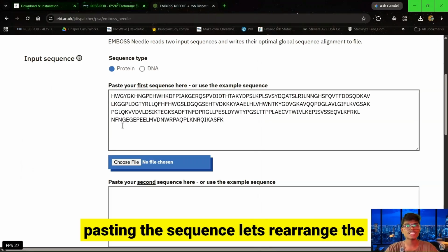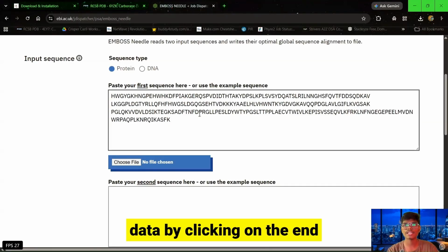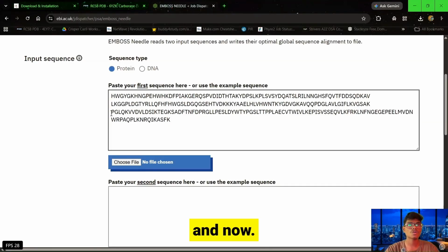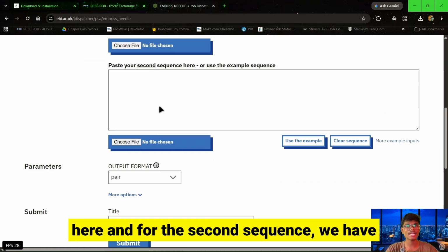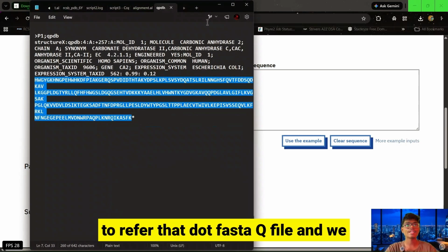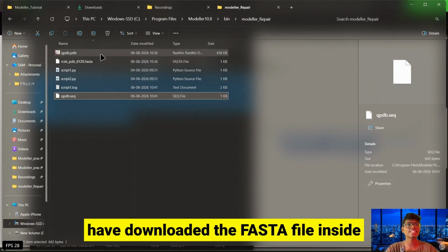And after pasting the sequence, let's rearrange the data by clicking on the end. Okay, the first sequence has been registered here, and for the second sequence we have to refer to the .fasta file, and we have downloaded the fasta file inside here.